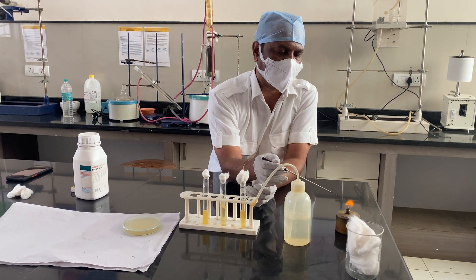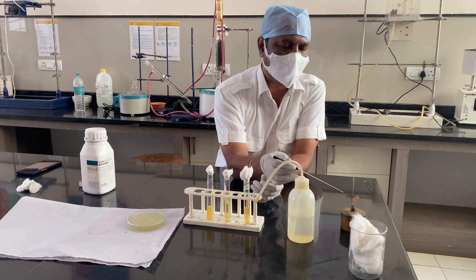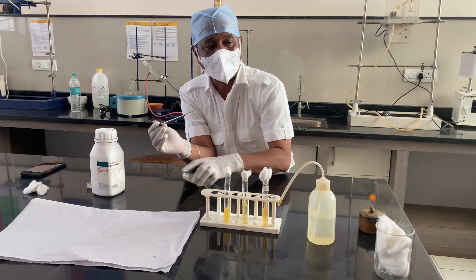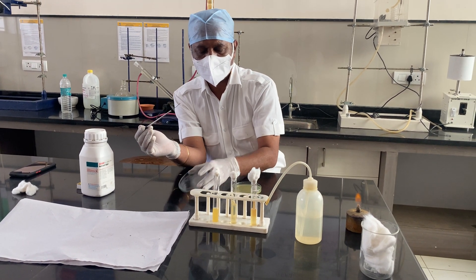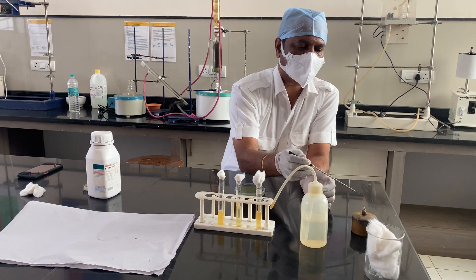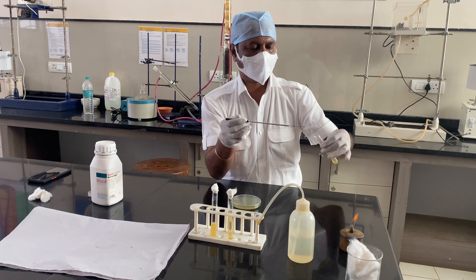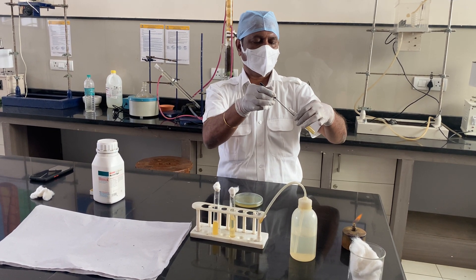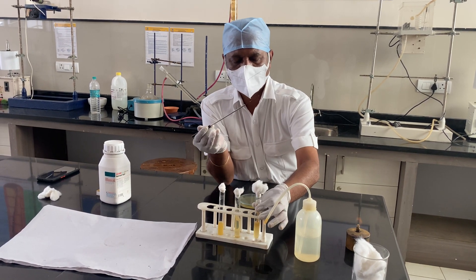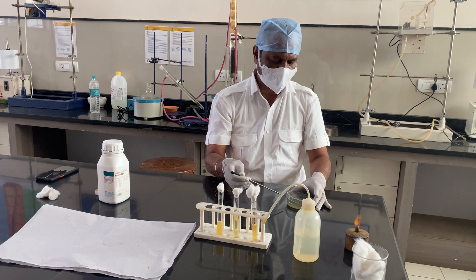In the third category, if you want to transfer to a solid media — in this case a petri plate with prepared solidified media — the same steps apply. After sterilization, take the sample from the source. To open the petri plate, do not open it completely; just open it slightly to minimize exposure to contamination.